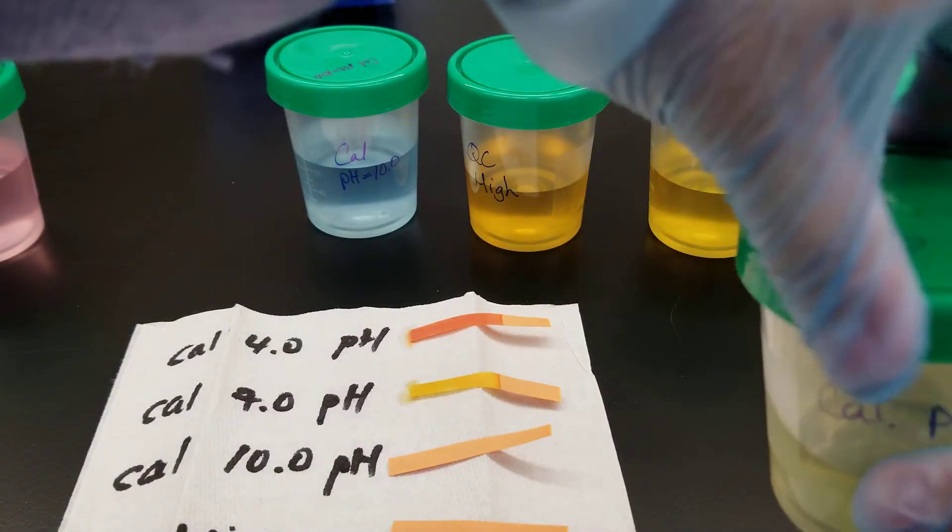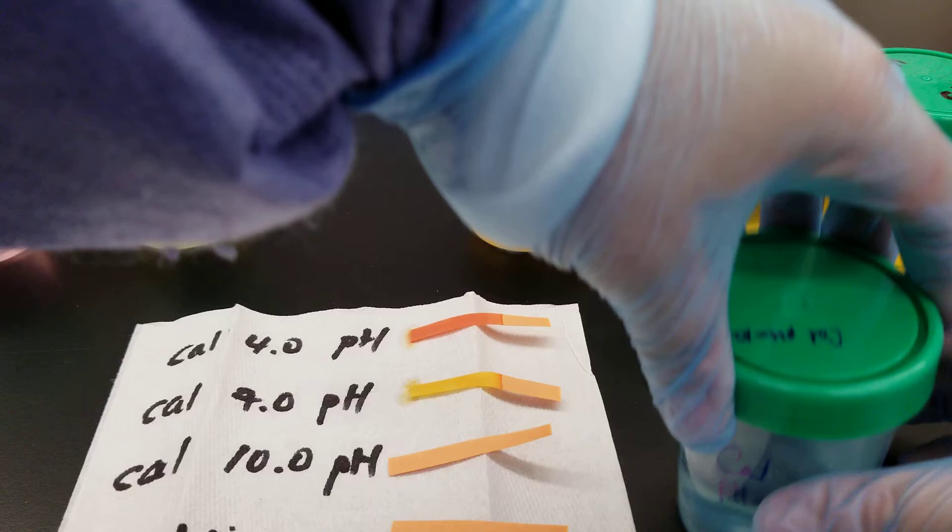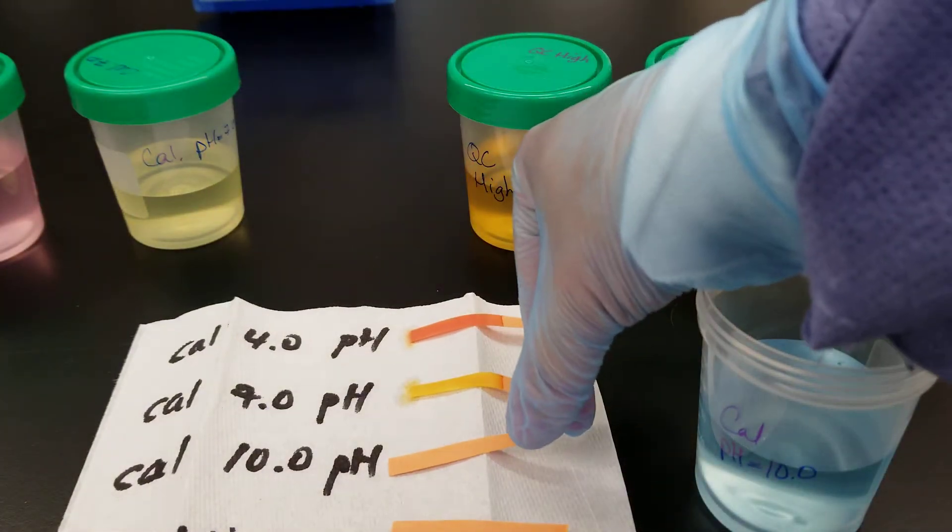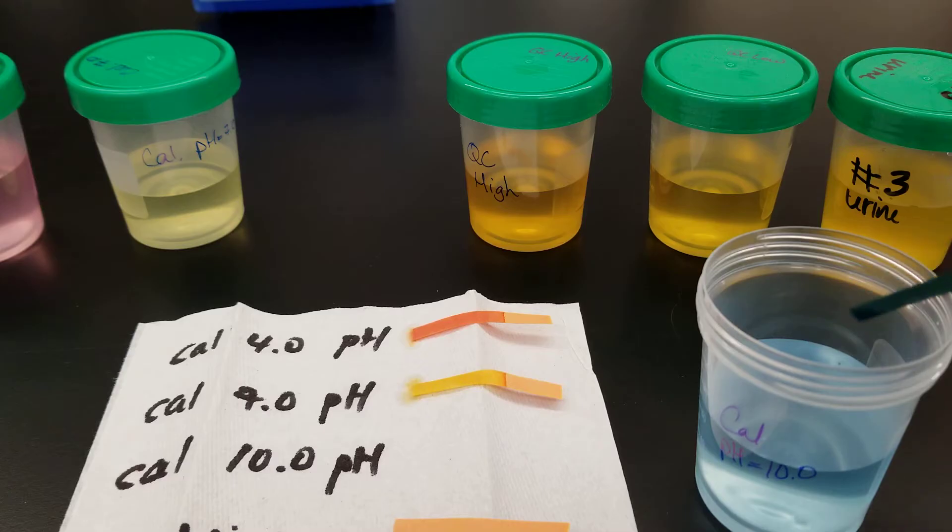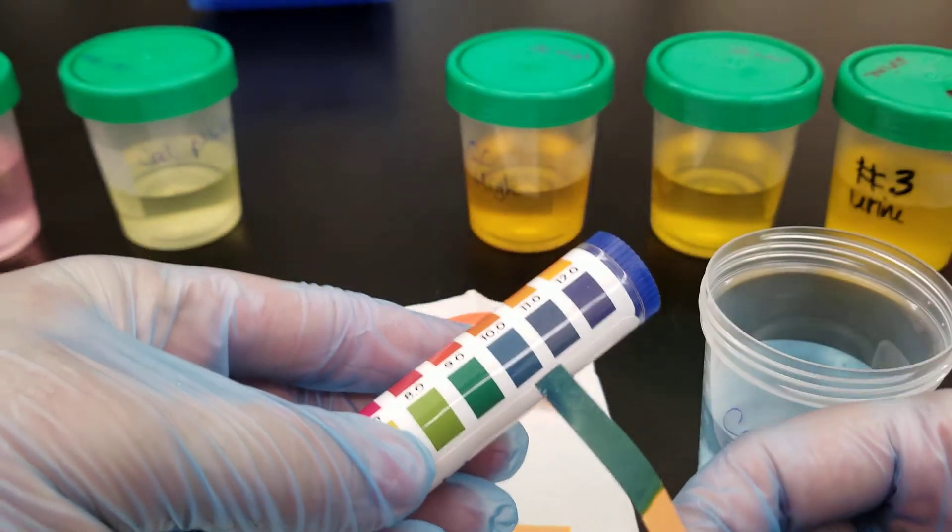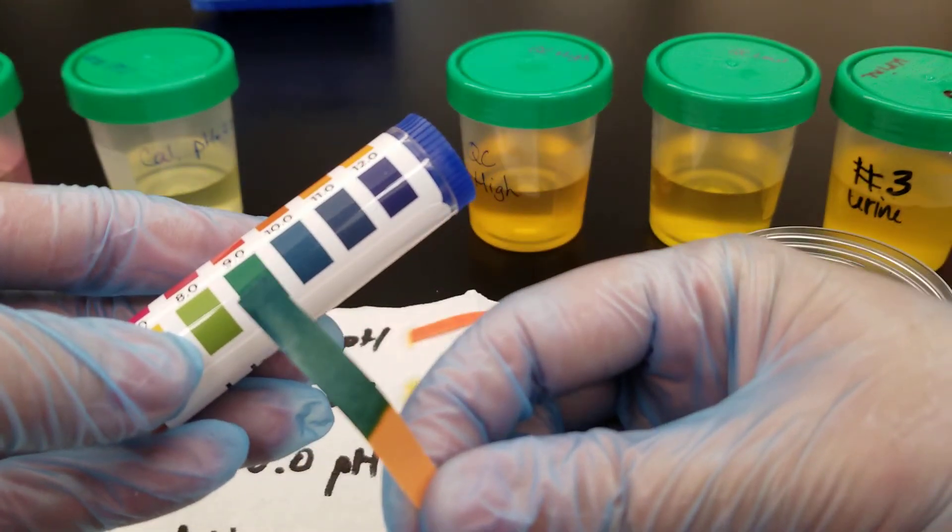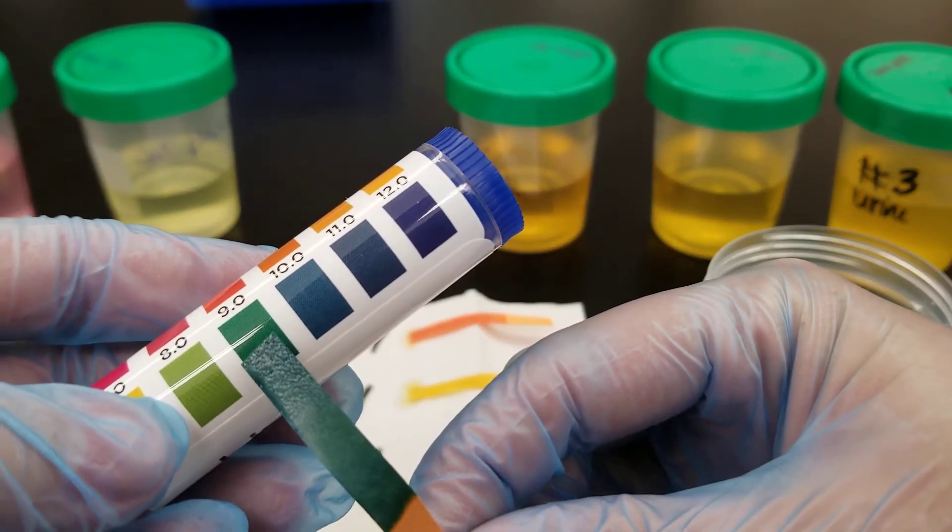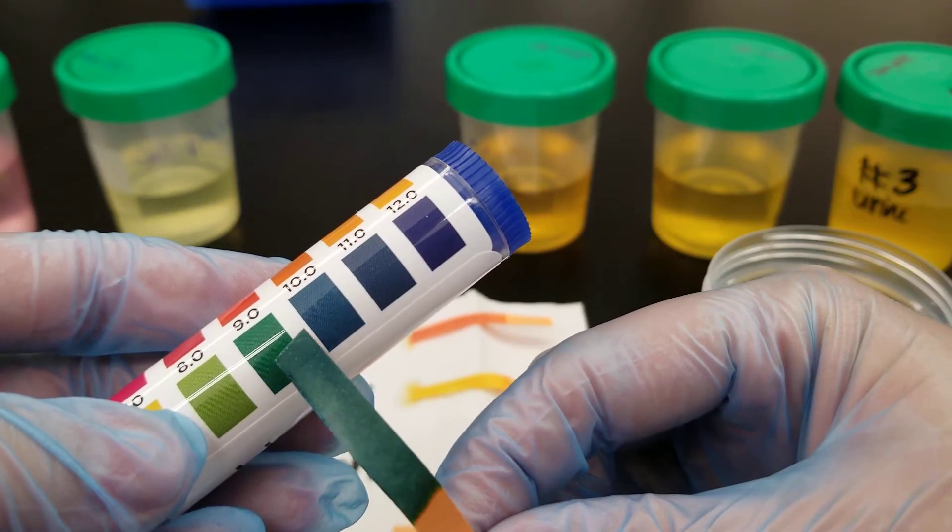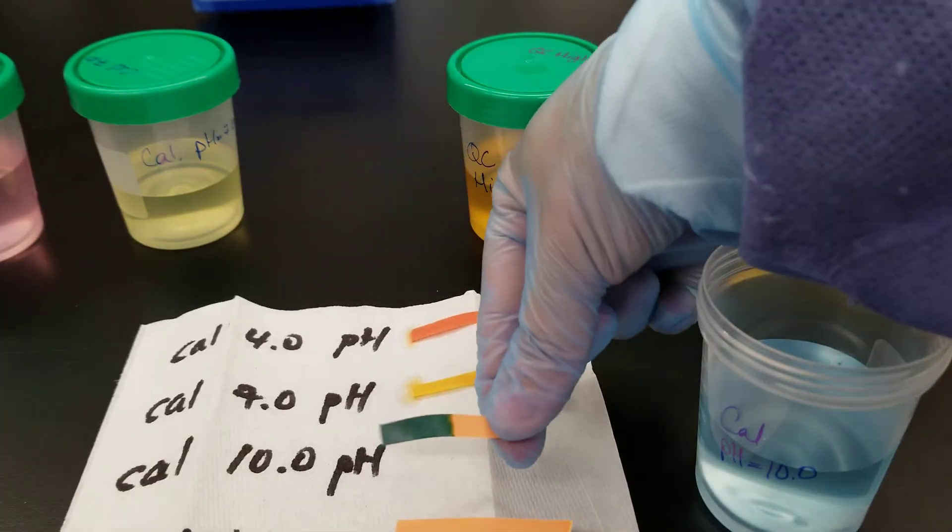We're doing 10 now, the blue one. If you ever get your gloves wet, you should make sure to change them and get new ones before you move on. So that looks kind of 9-ish. That to me looks like a 9. And if you remember when we did read it using the meter, it was in the 9. It was in between the 9 and the 10.